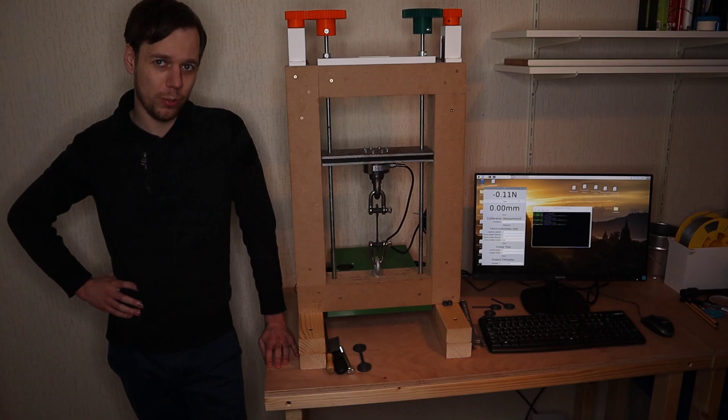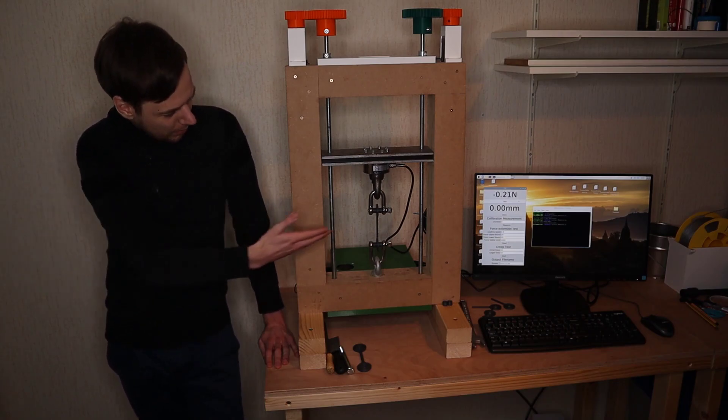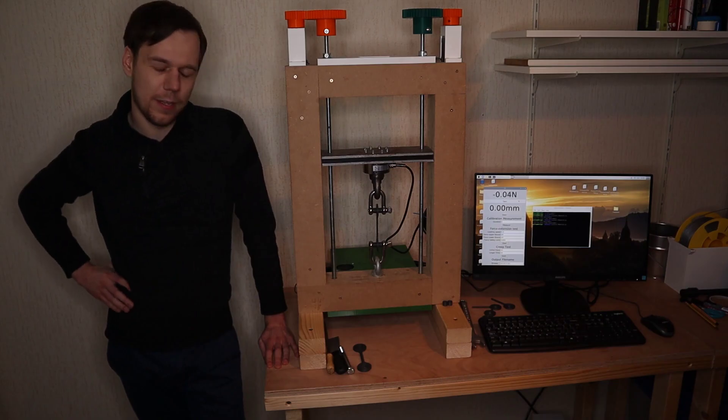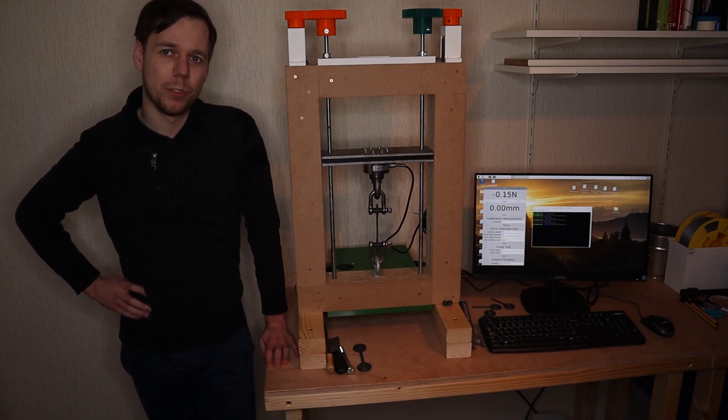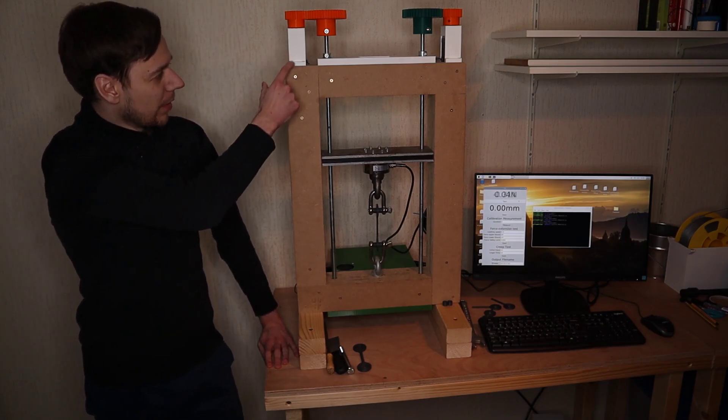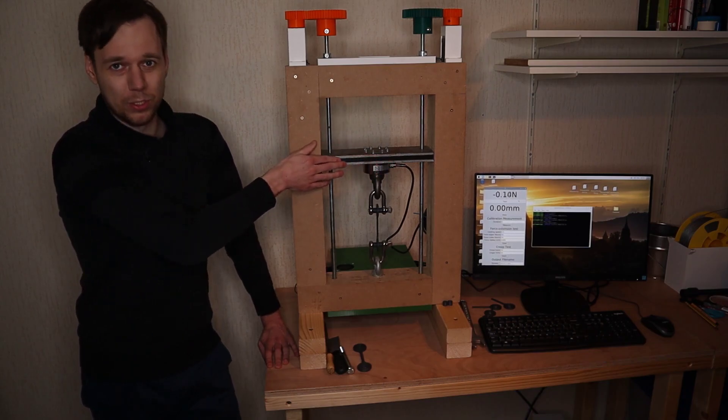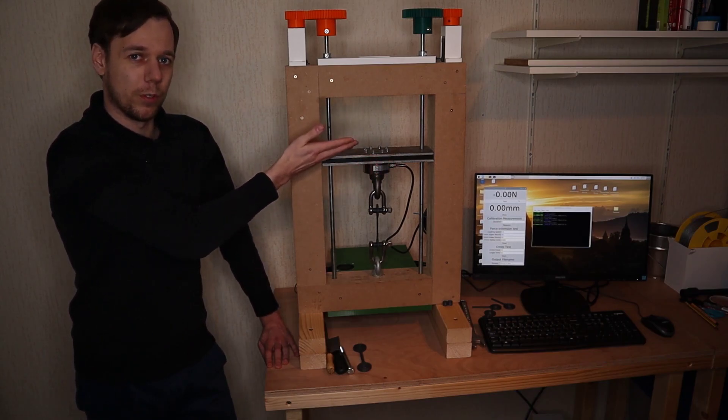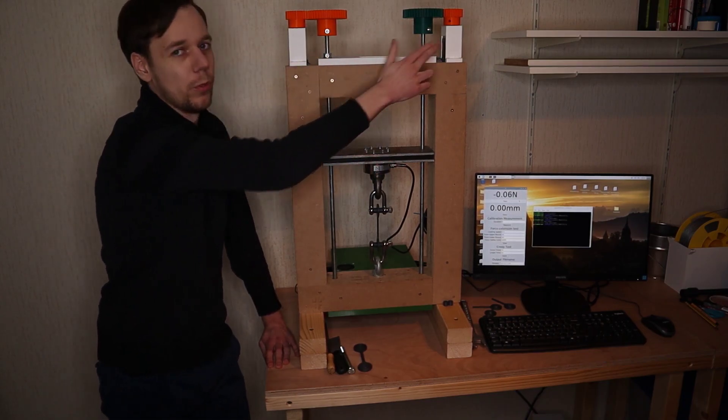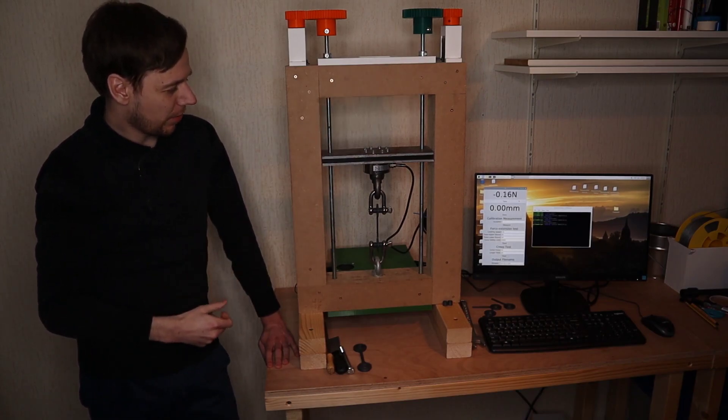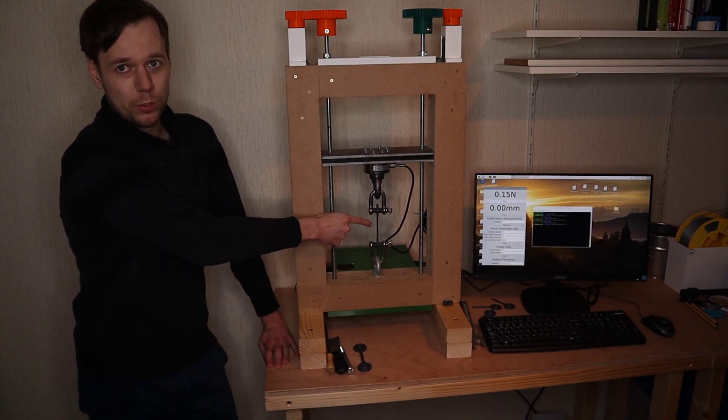To better show you the phenomenon and how I investigated it, I've loaded a sample of PLA in the machine. What the machine will do in a moment is it will cause this horizontal piece called the crosshead to move upwards by use of these two stepper motors over here, and as it does so it will apply a force to this sample.